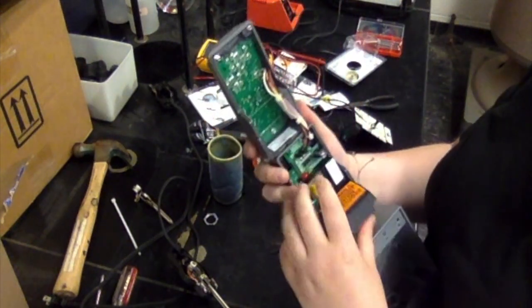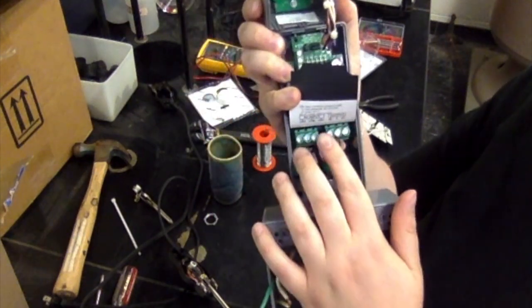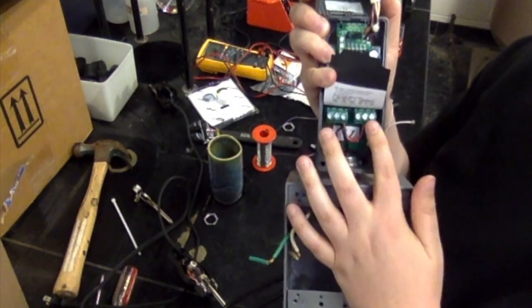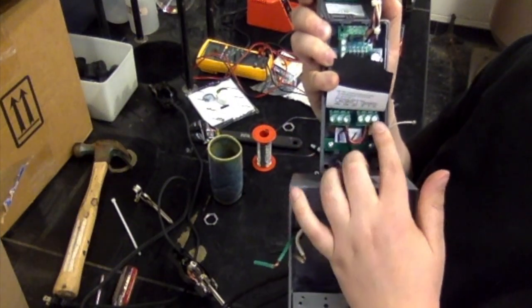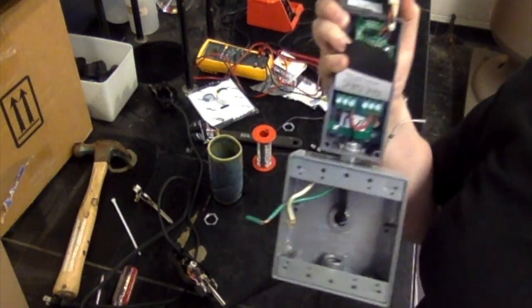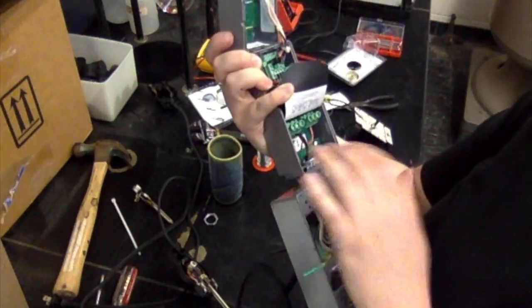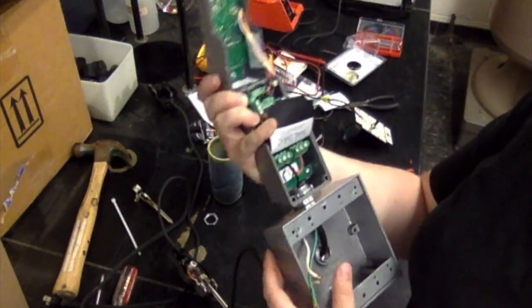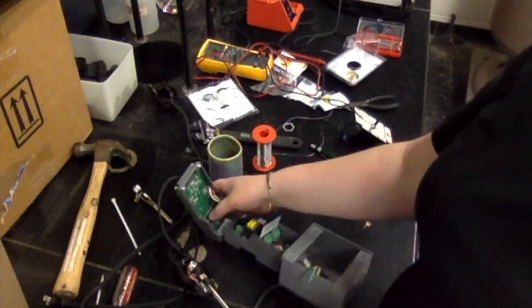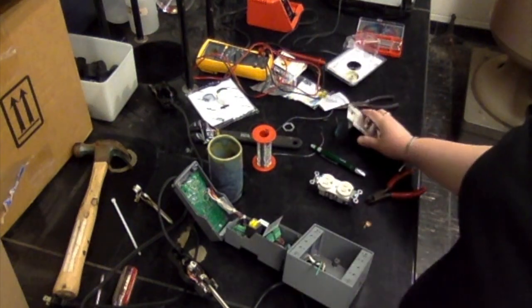The first thing I'd like to do is go over the types of connections we're going to make. If you look inside the A419, there's a series of 6 ports here. I'm going to be numbering these 1 to 6. They're also described in the same way in the file, so if you're confused about the ordering, go ahead and look there. There's also going to be a couple screw nuts that we'll need to use, but you should have gotten a couple of those with the dimmer switch, so you don't need to get those separately.